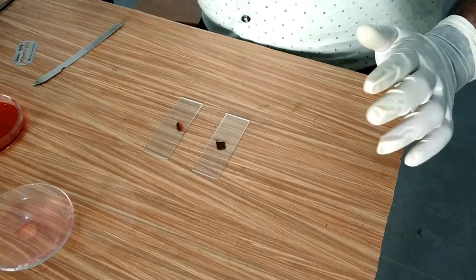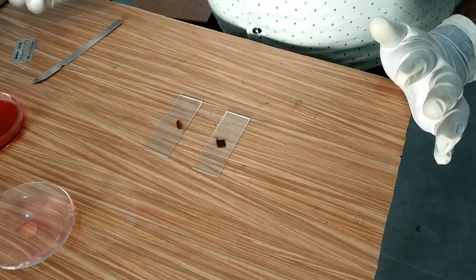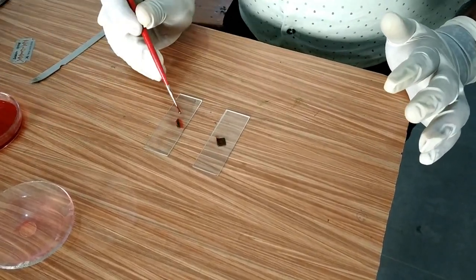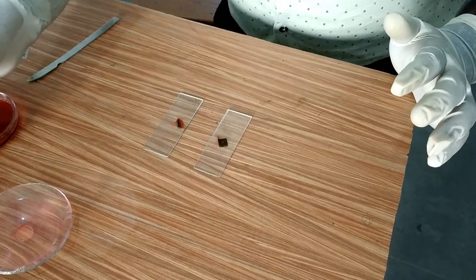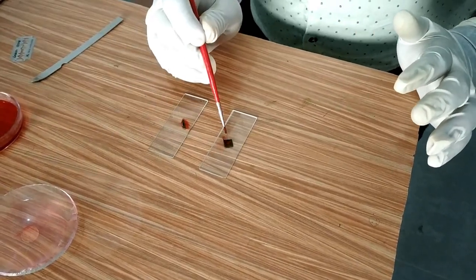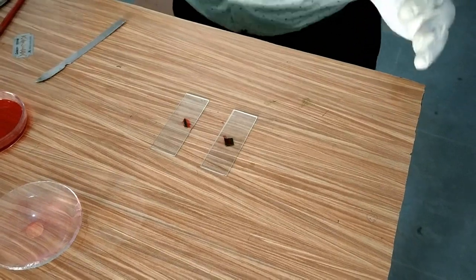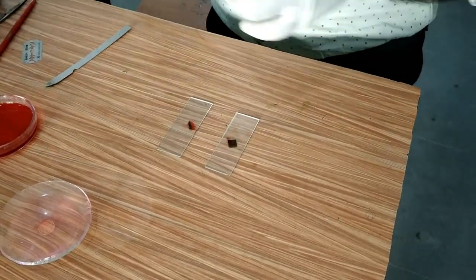After 30 seconds, I will take one drop of water on both of the slides to avoid excess staining.